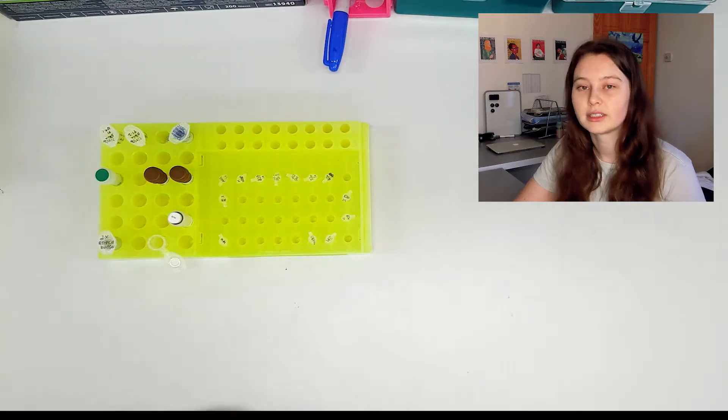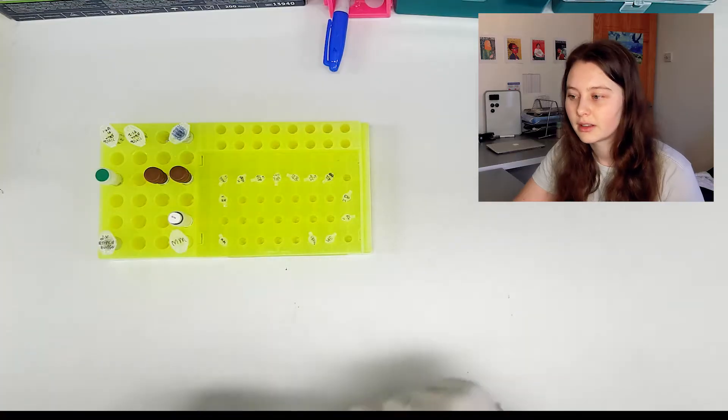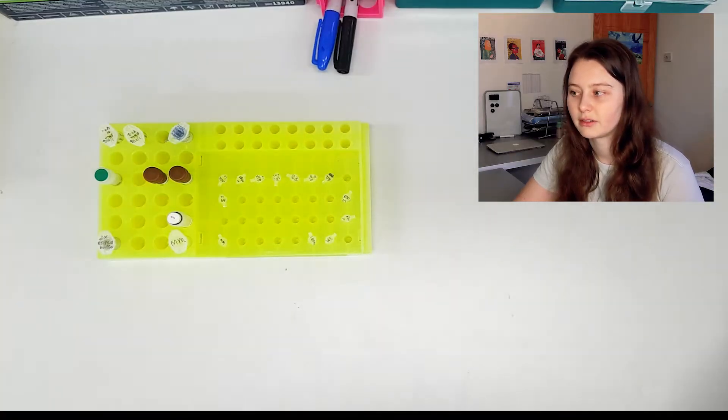So putting all those components together now in a tube. This tube does not need to be well labeled, it's only going to be around for a few minutes.